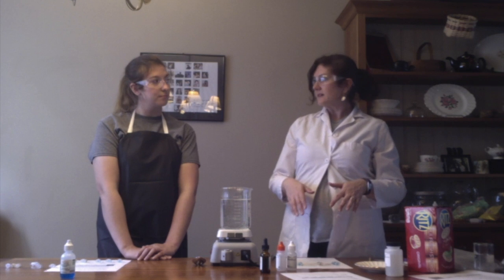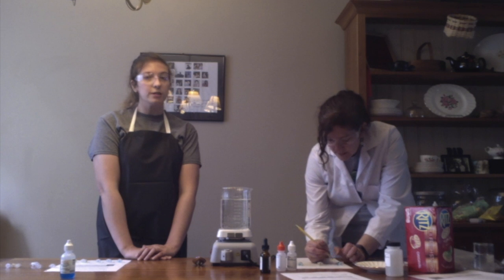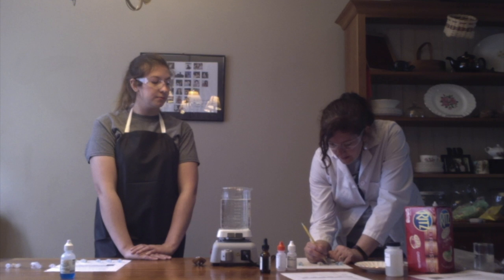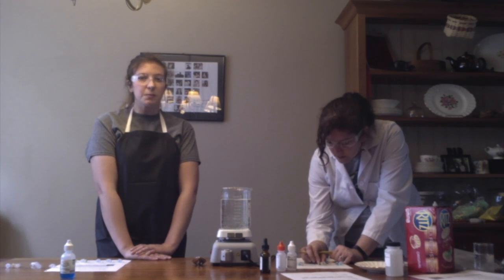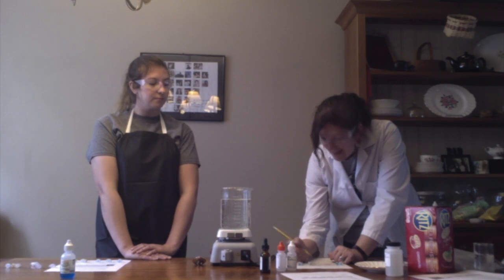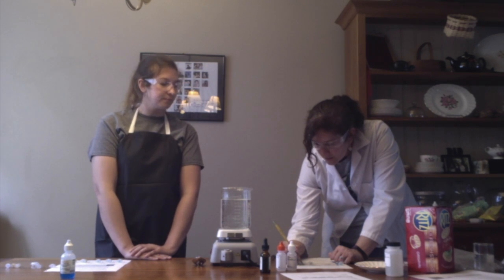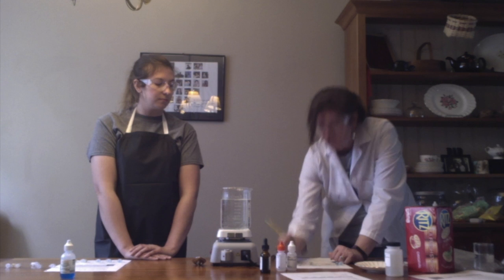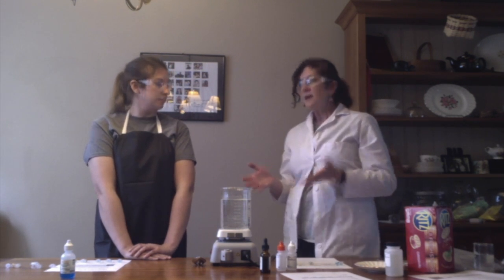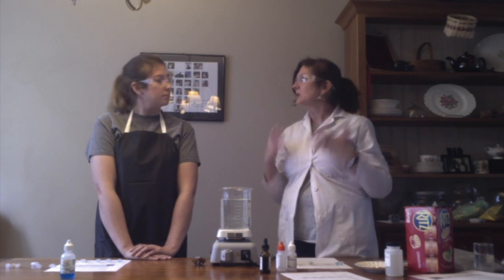So if we take a look at these, Lizzie, if you could describe them, I'll write what you say. So for the water, it's still a very light blue, like the Benedict's solution. For the glucose, it's turned almost a brown, sort of yellow color. And the starch, it's also blue, like the Benedict's. So the only one that really shows us a change would be glucose. So glucose is a very simple sugar, and the way Benedict shows us that it has found the glucose is that it turns this yellow color.